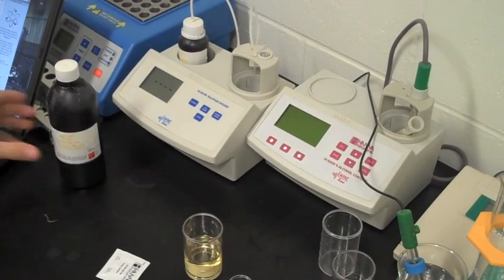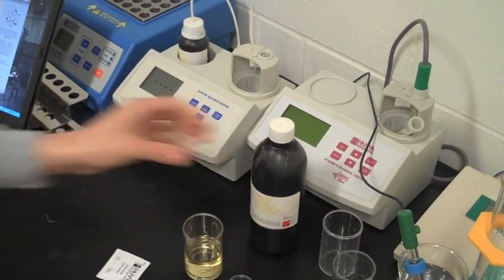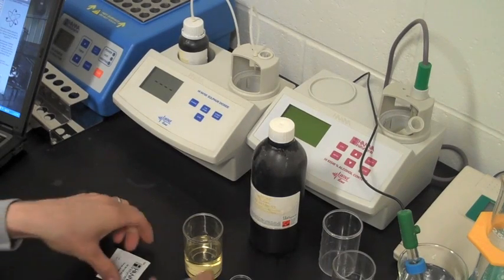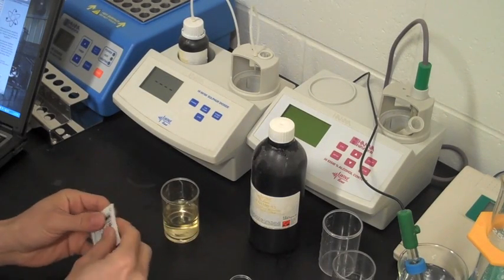All right, the next test I'm going to do here is test for the free SO2 in the wine. That basically just keeps the wines kind of stable.